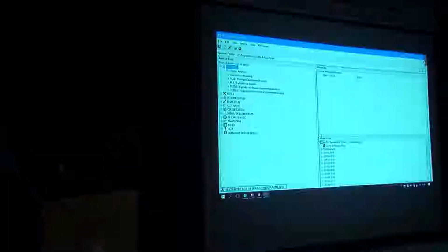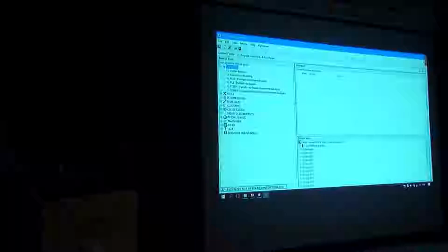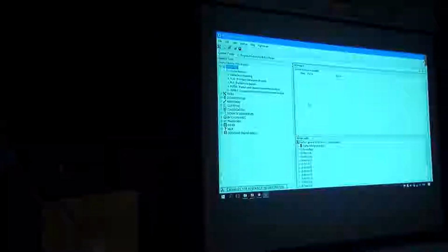But I will show you the standalone version and how you can analyze Aquaphotomics data. The nice thing about it is very good visualization and color coding features, which is normally missing in the publications that I've seen. You don't see the data, and you may miss the point if you don't visualize it. So hopefully I can make it interesting by showing you how you can bring out features from the spectra that are otherwise invisible. So this is the workshop data set. You can drag and drop it into the workspace.